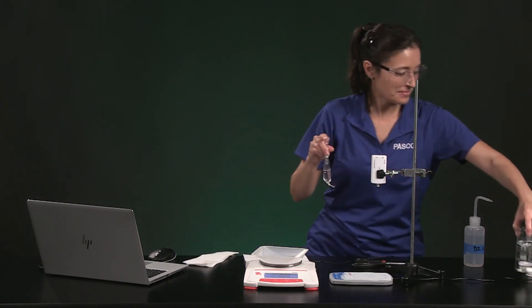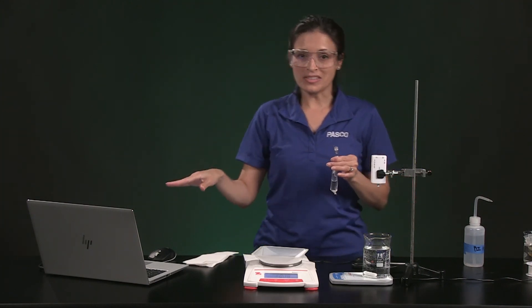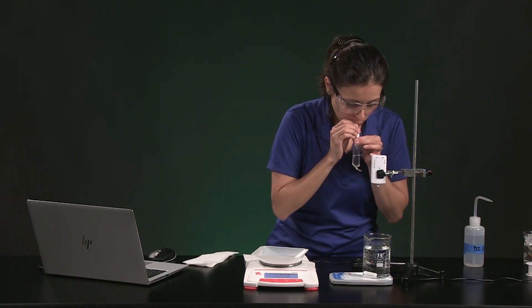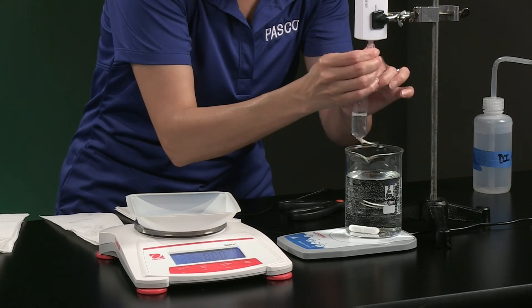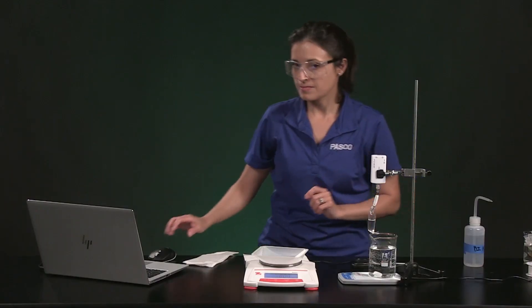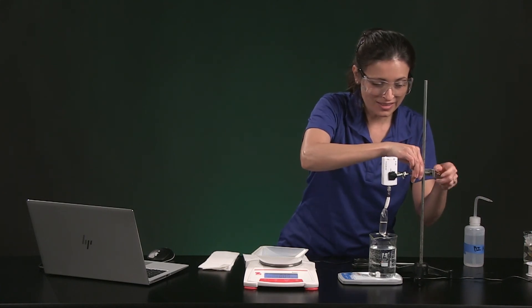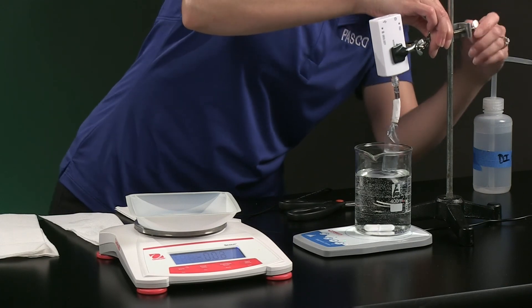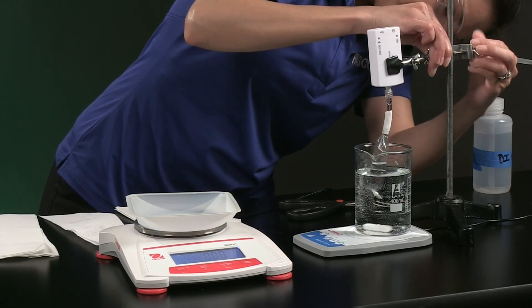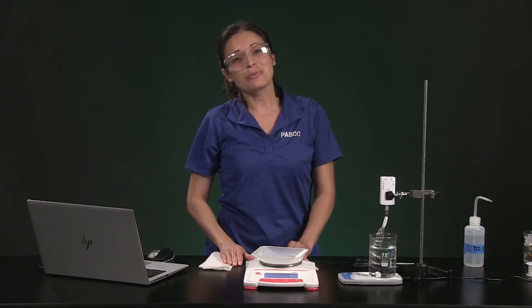I need a new beaker of water. Then I will add air to the bag and connect the sensor to the tubing and start data collection and then start the magnetic stirrer and lower the bag into the beaker. I am going to be careful to not get the magnet to hit the bag. The data collection will continue for 15 minutes so we will fast forward the data collection for you.